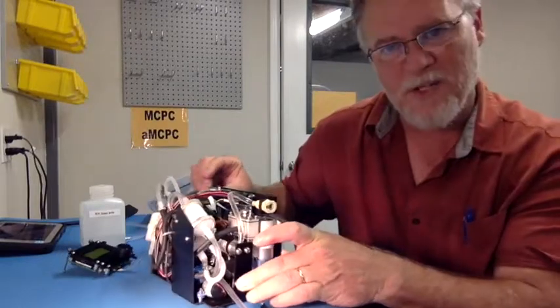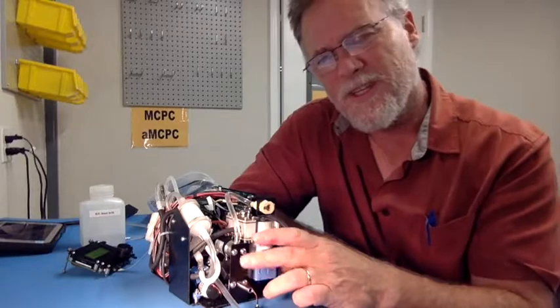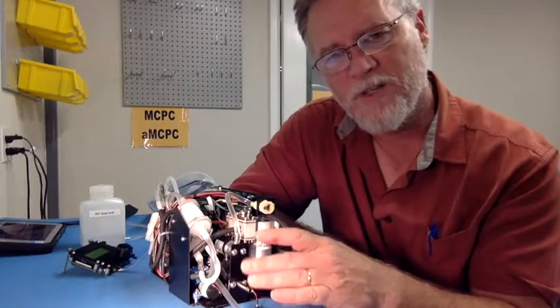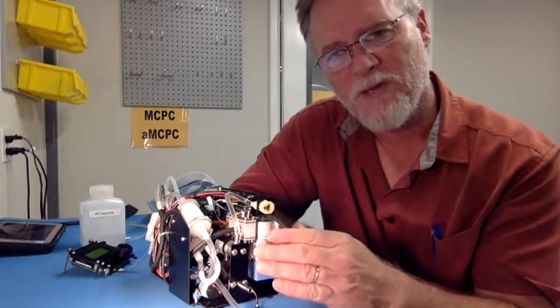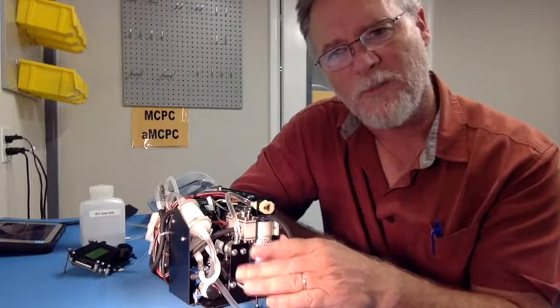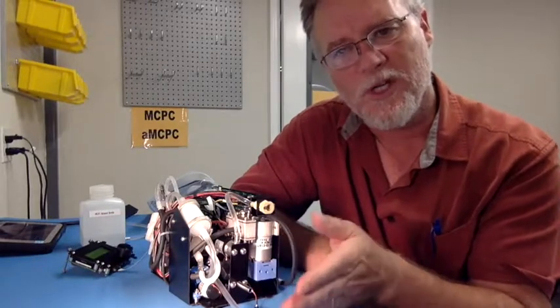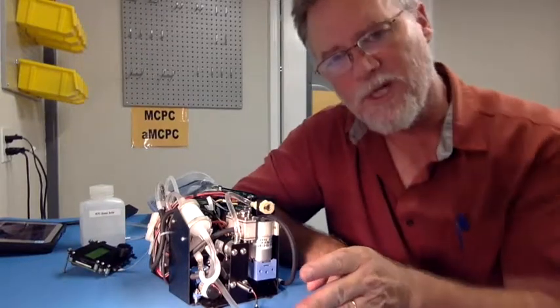One of the key advantages of the mixing CPC, unlike a lot of other condensation particle counters, is its speed. It uses a completely different physics, which is a carefully controlled turbulent mixing of the sample and the saturator flows to create a very, very fast response time, about 180 milliseconds. So the unit is ideal for applications where you need a very fast response, like UAV or aircraft measurements, or other conditions where your aerosol population number concentration is varying a lot with time.